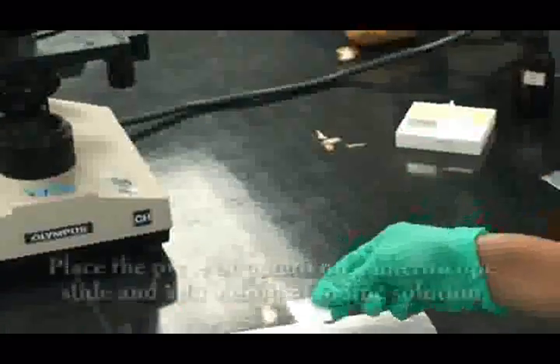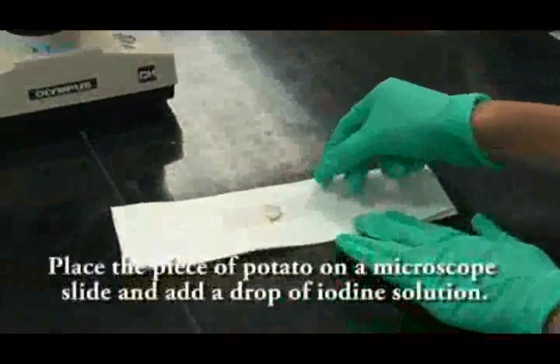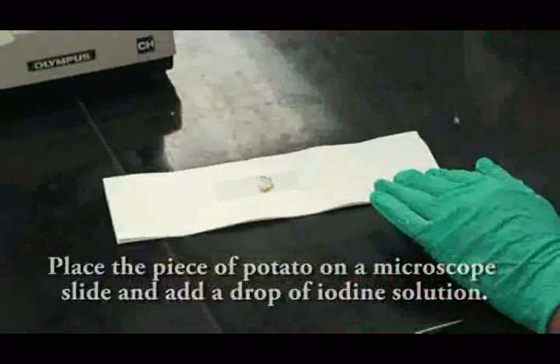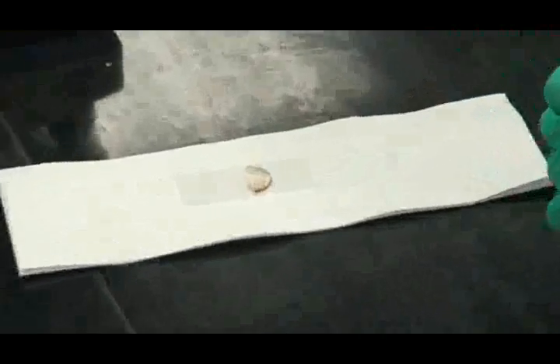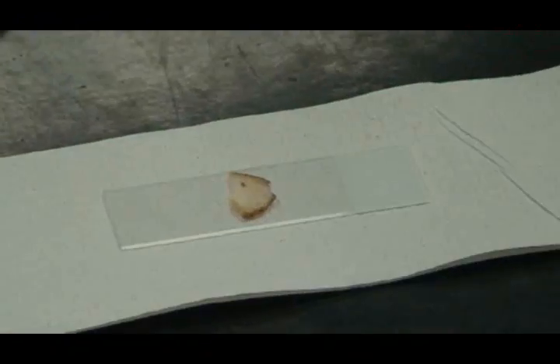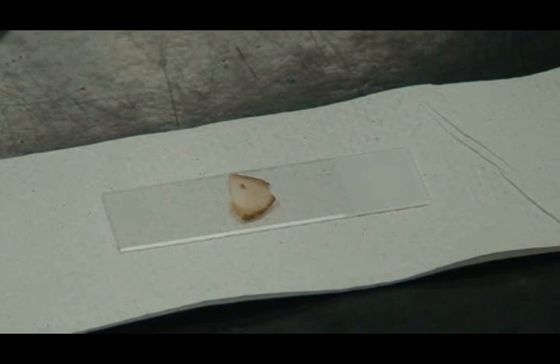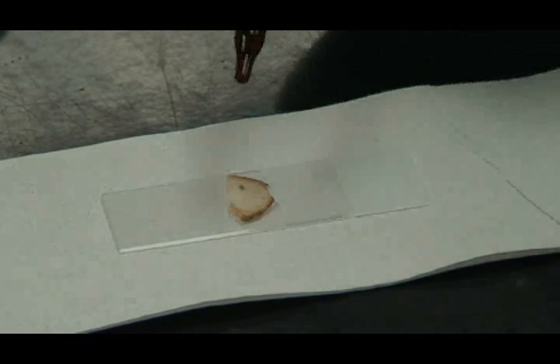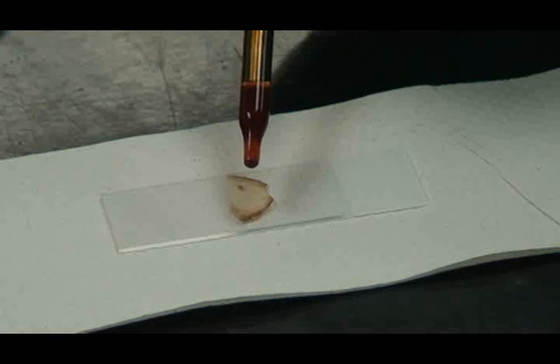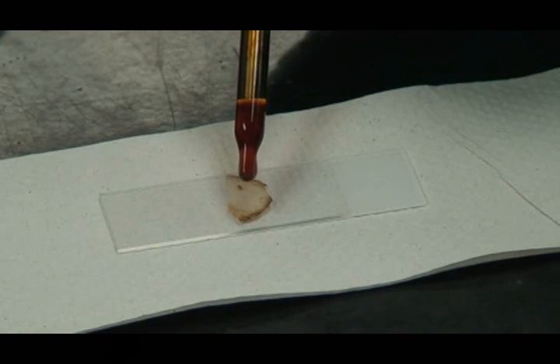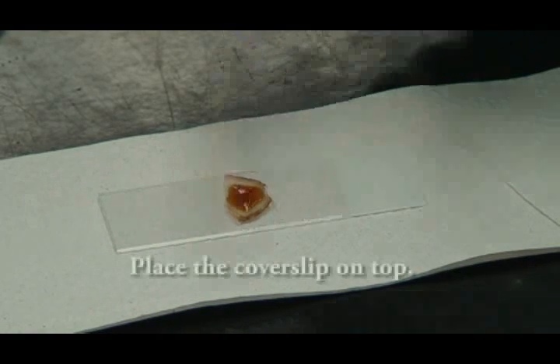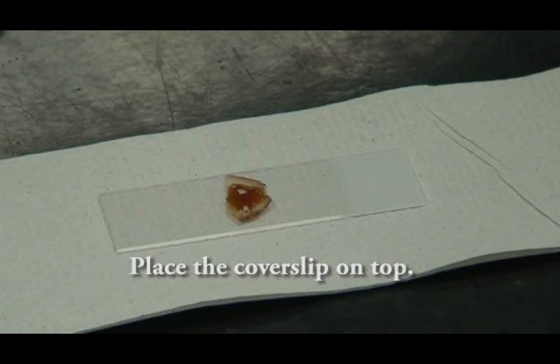Place the piece of potato on a microscope slide and add a drop of iodine solution. Place a cover slip on top.